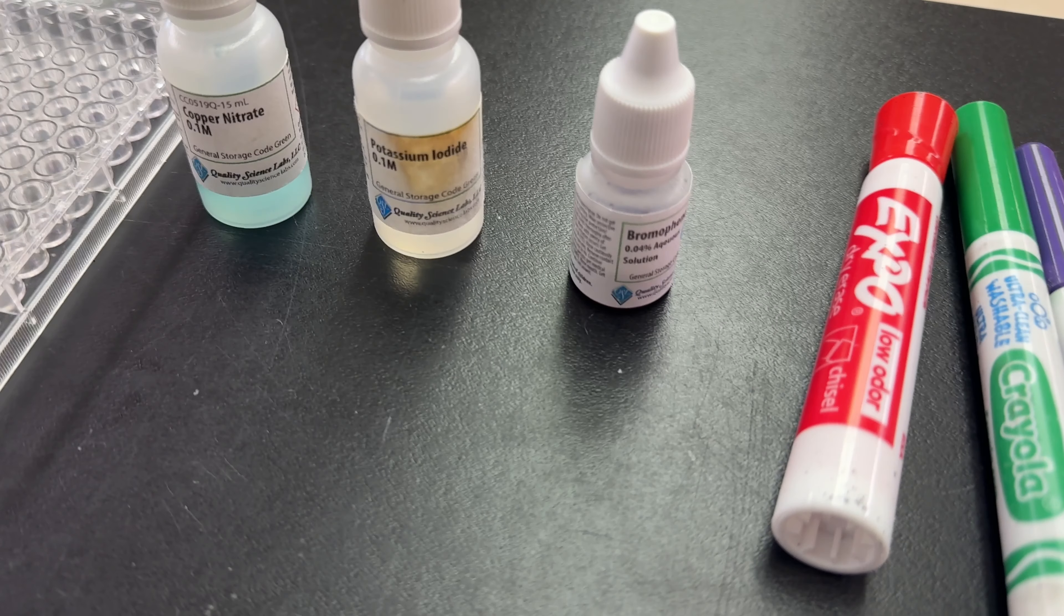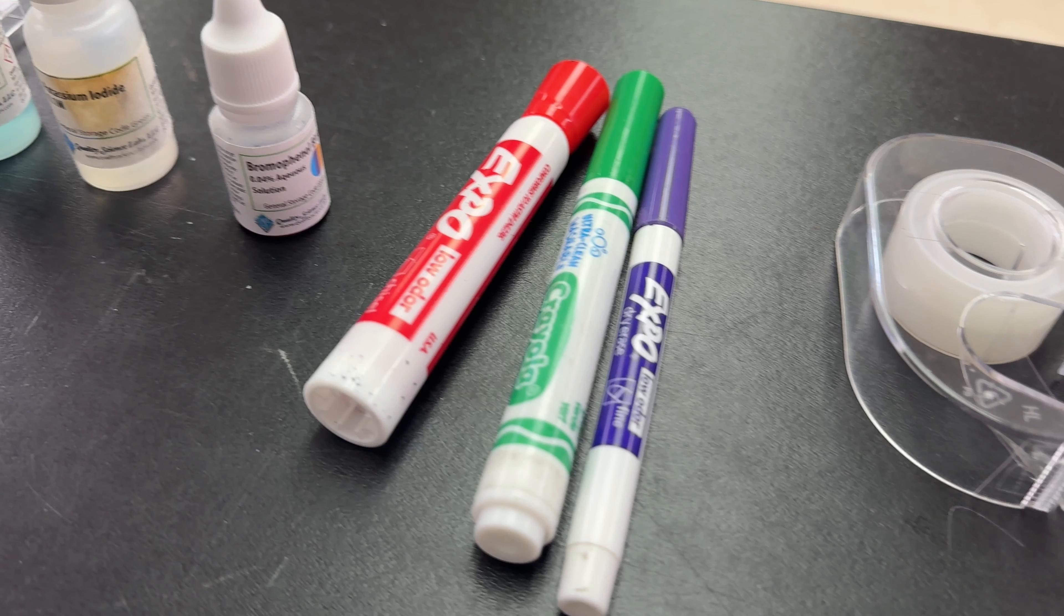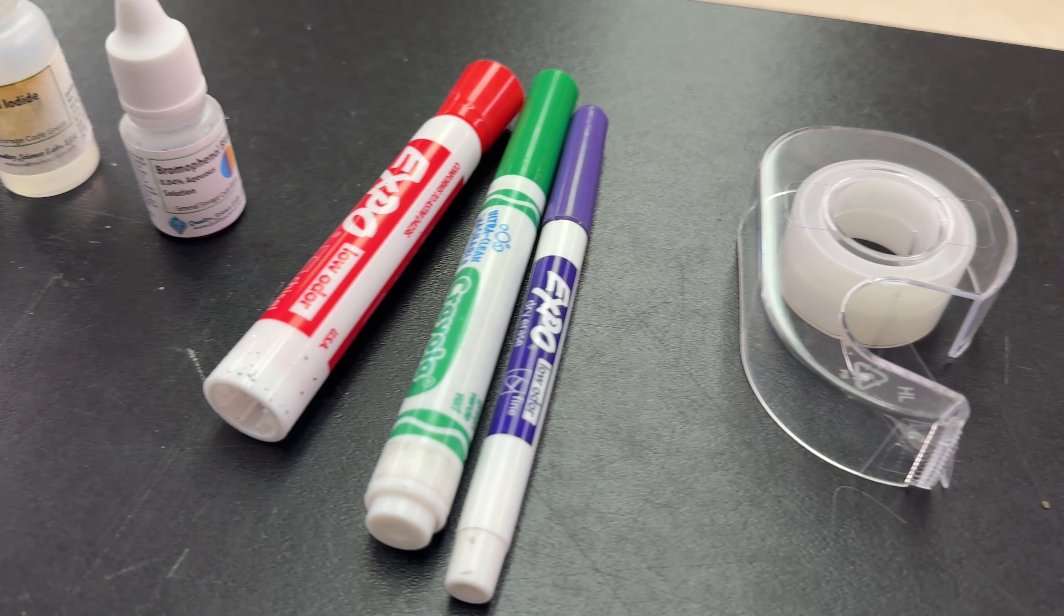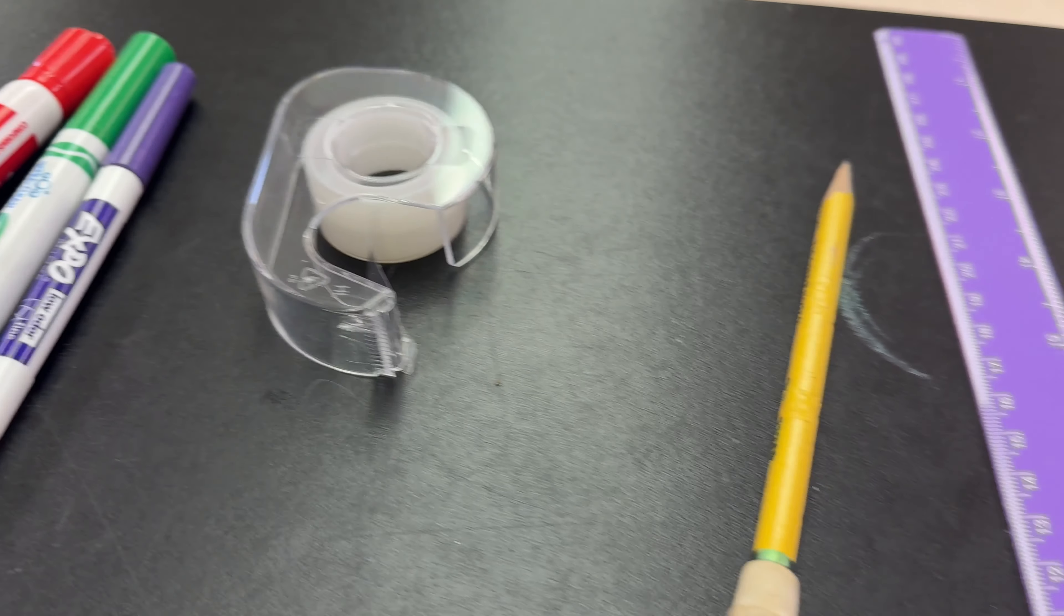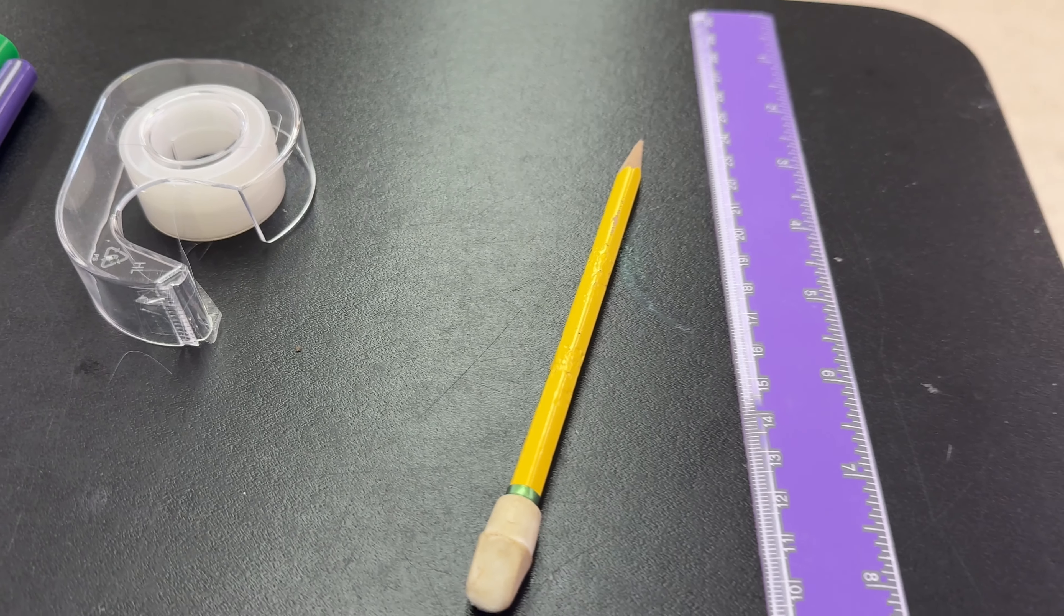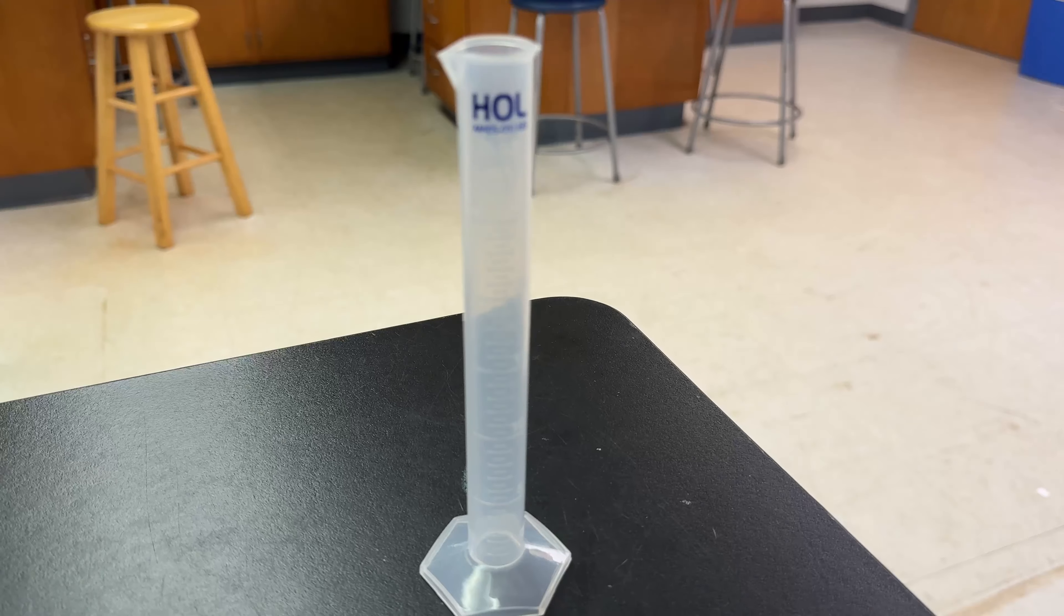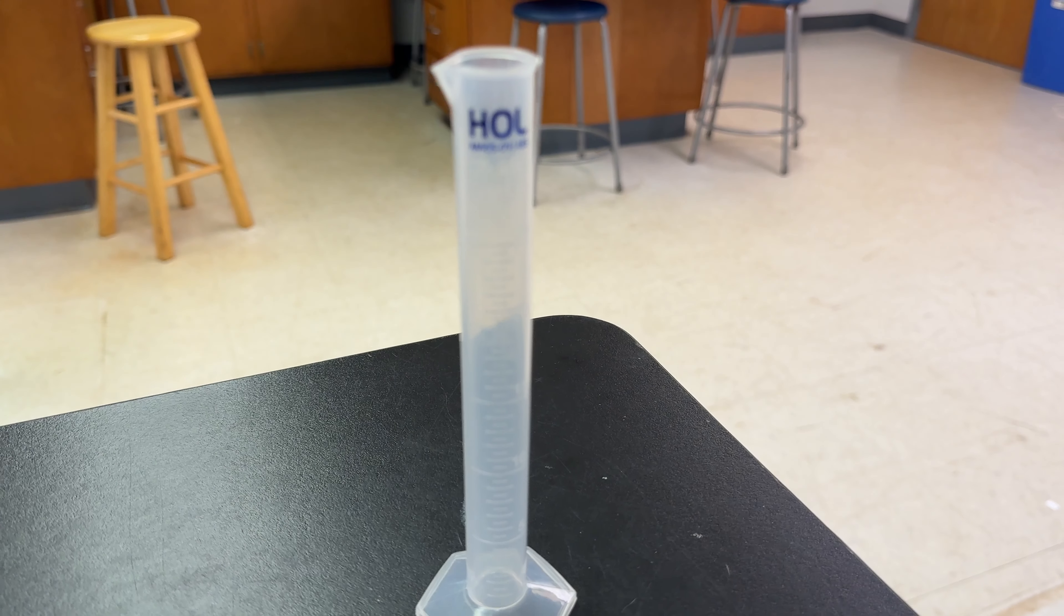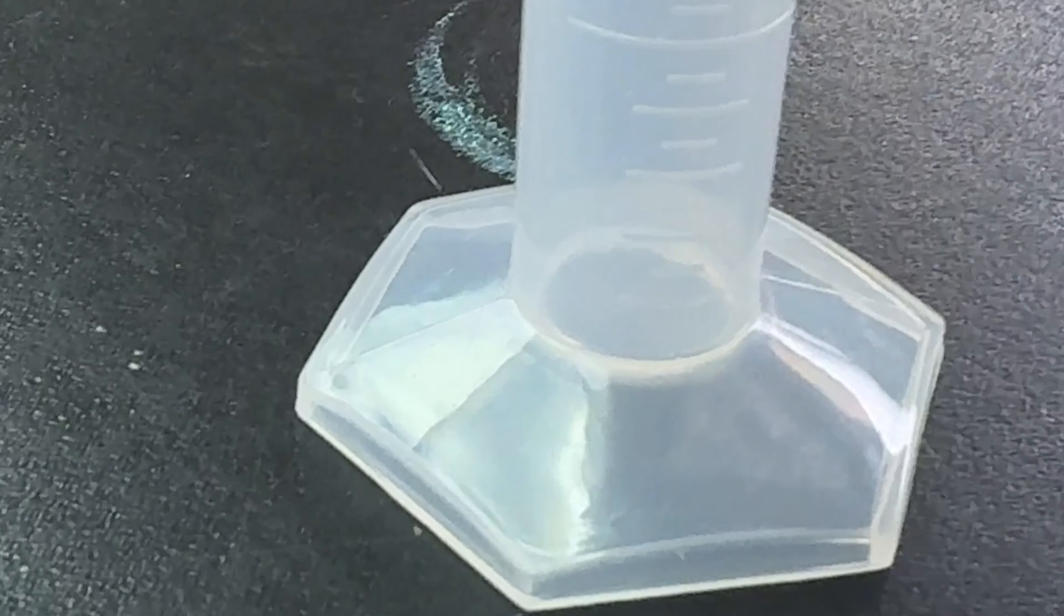I am using some extra dark colored felt tip pens, but you can also use food coloring, fruit or vegetable juice, tape or a stapler, a pencil, a ruler or measuring tape that measures centimeters, a Q-tip. I also found it helpful to have a beaker that measures individual milliliters because you only need three or four for this experiment.